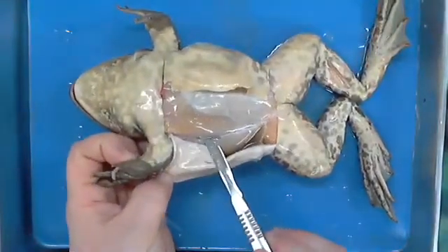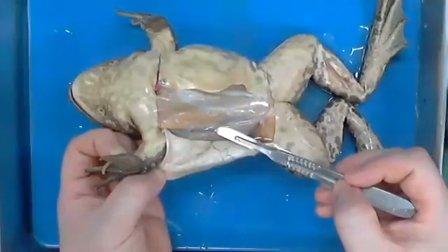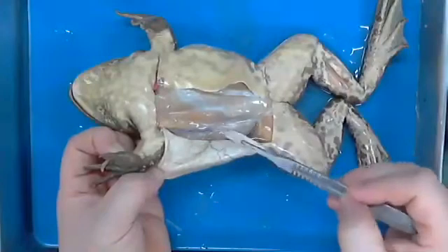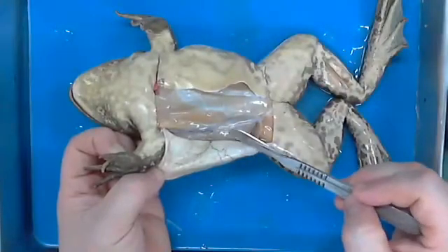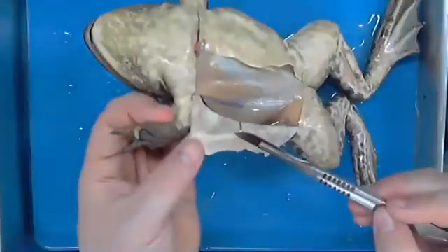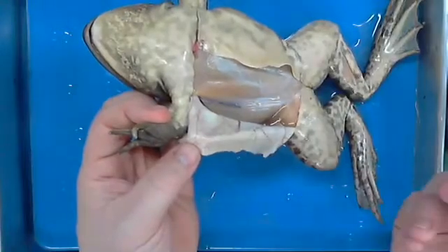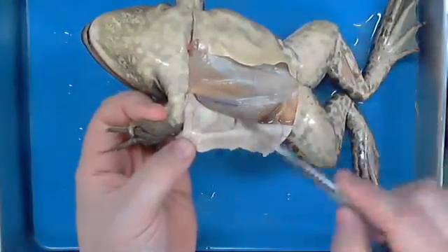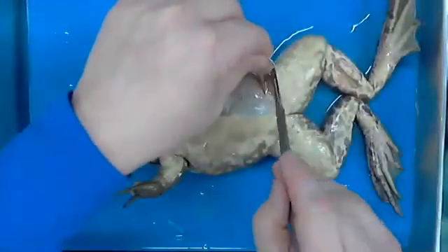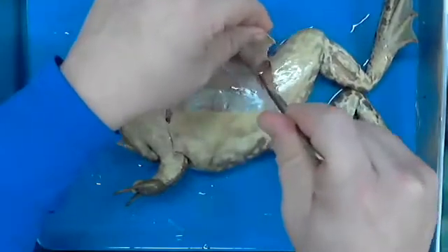What's this dark line? A vein. All right, an artery or a vein, technically probably both together as they travel typically in pairs. So its responsibility is either taking care of this ventral surface on this side to feed all of this. You can even see, notice the skin, see all of this lineage that's here. Of course, obviously all of his skin is cells as well and still have to be fed. Of course, this is what we define as capillaries. Remember, capillaries are where we actually have the ability to transmit fluids in between and out of.